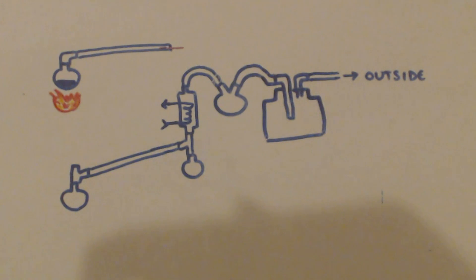The first reactions weren't getting hot enough, but on the later reactions I had the whole furnace tube filled up and it was just over-reacting. The point is I need an empty tube to determine the correct length to use with my quartz furnace, so the vapor reaches the right temperature without overreacting.